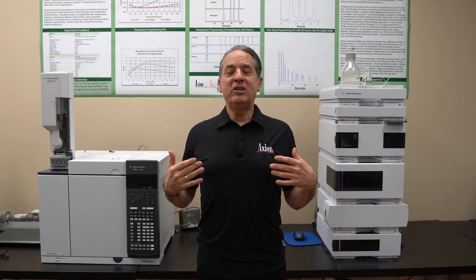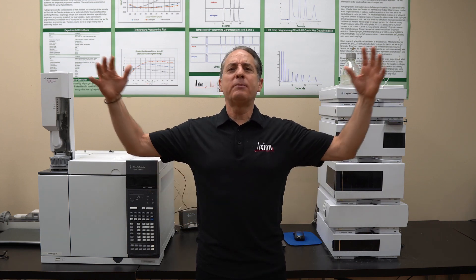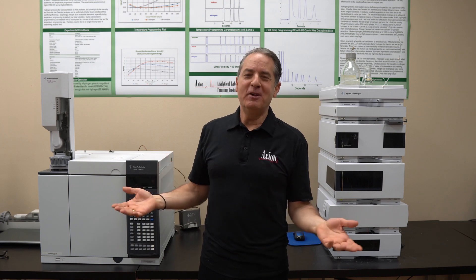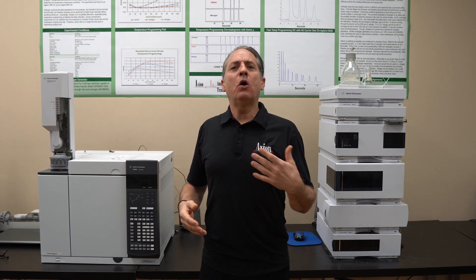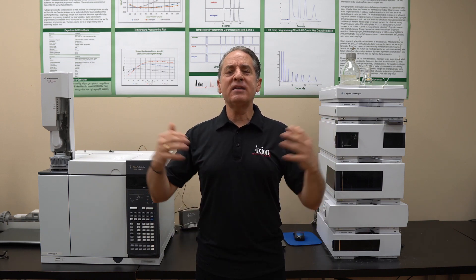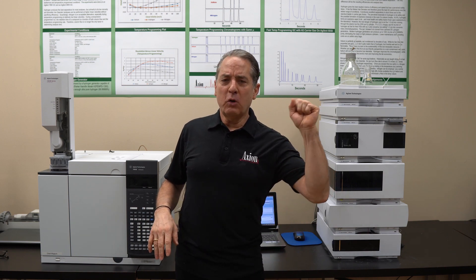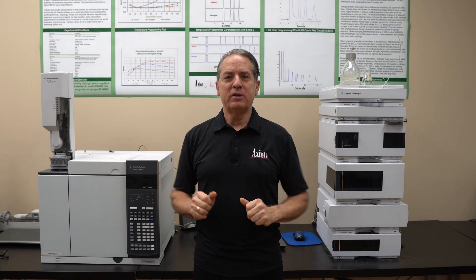And then we're going to inject our sample and run a temperature program. What I tell people in my class: we're going to try all the temperatures in the universe. The lowest temperature you can use on a GC is pretty much room temperature — we can't go below room temperature unless you have cryogenics. So room temperature, I call about 40 degrees. The highest temperature is determined by the column. So let's say we're going to go from 40 degrees to 325 degrees at 20 degrees a minute.